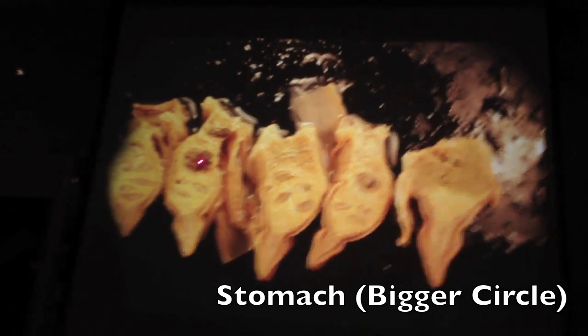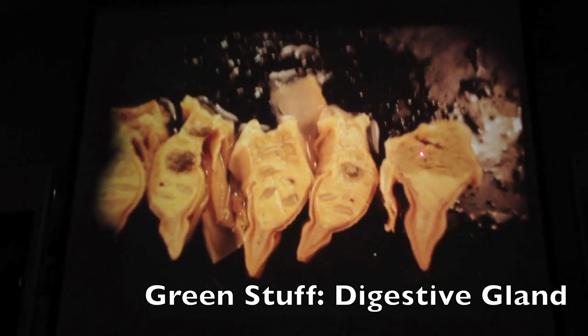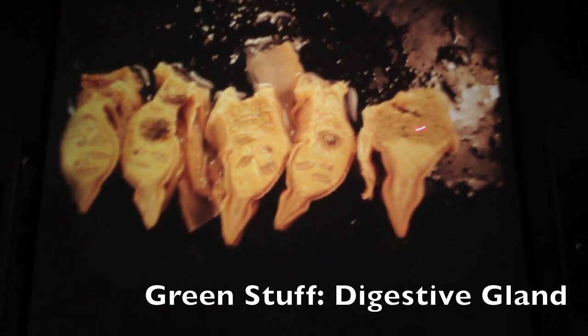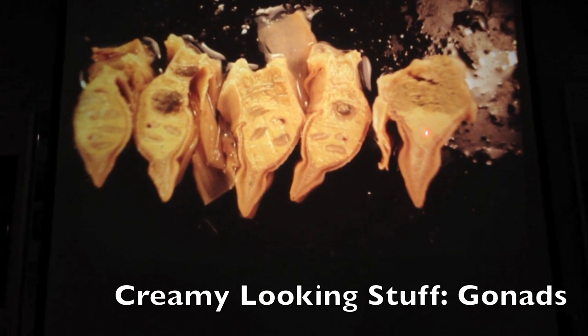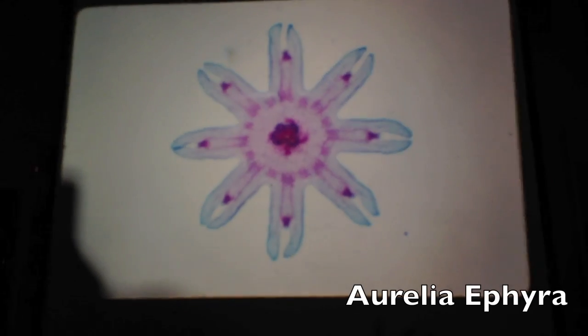Here's that clam sliced in pieces. Foot's down here. Here's the intestine going through. Stomach right here where it's bigger. And then you got this creamy looking stuff and this green looking stuff. And what's the green looking stuff? Digestive gland. And the creamy looking stuff? Gonads.